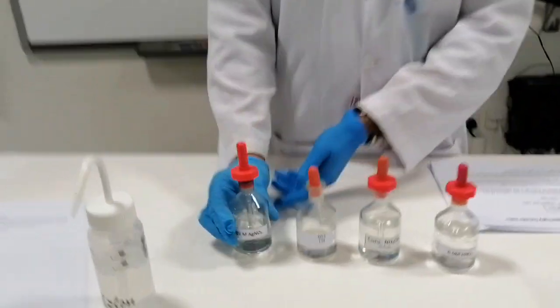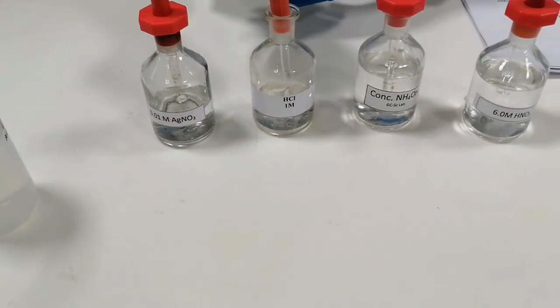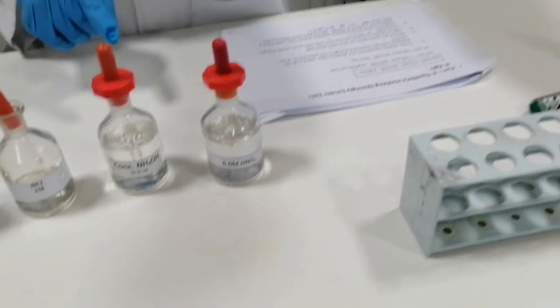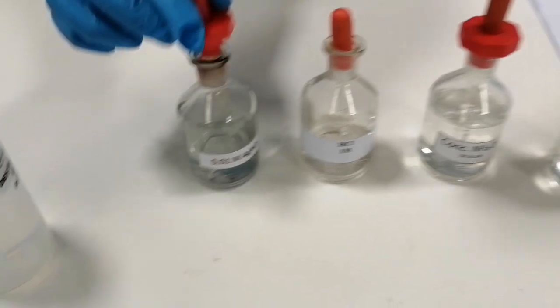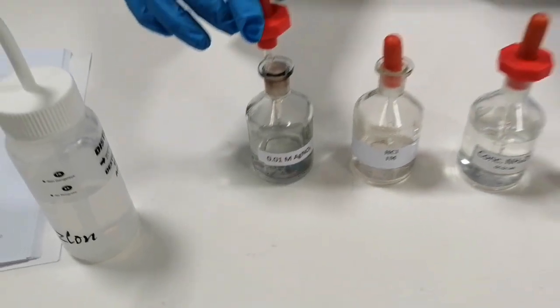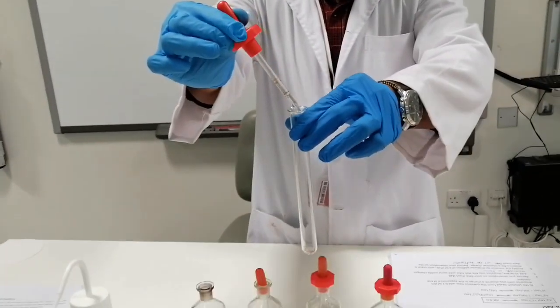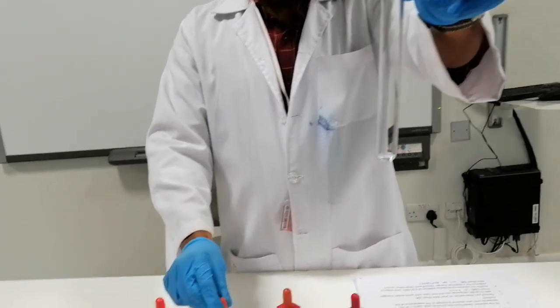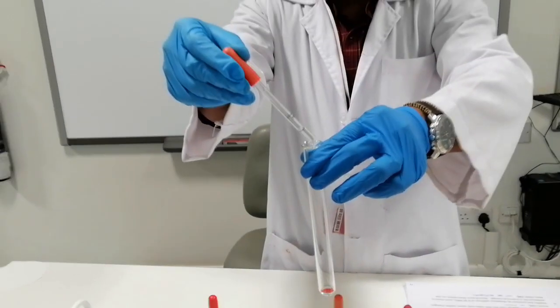To do this experiment, we need again the silver nitrate. The silver nitrate will give you the silver ions, and we have HCl here. This will give you Cl minus ions. So we go back to the test tube now. You take a clean test tube, take the silver nitrate, open and add maybe 1 or 2 or 3 drops. Less than 1 ml should be fine. Then you go to the HCl bottle. You open the HCl, then you add HCl, hydrochloric acid, drop by drop into the solution.